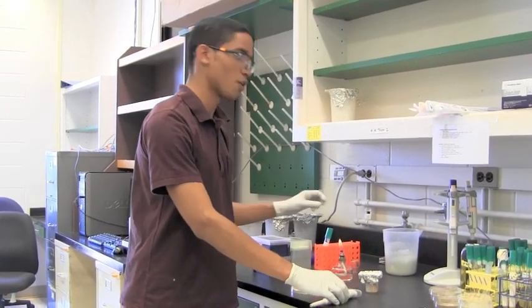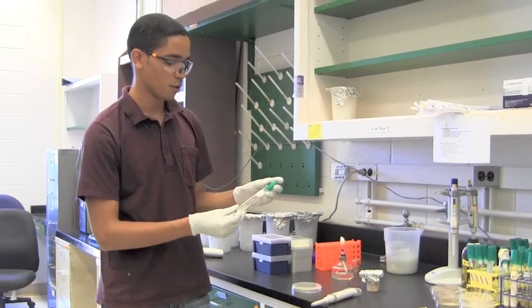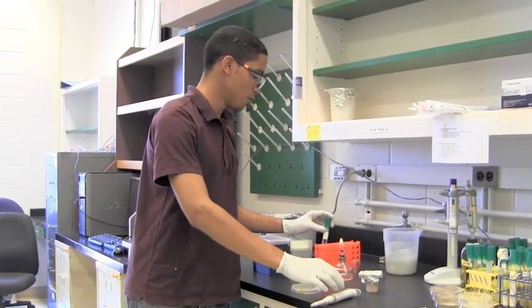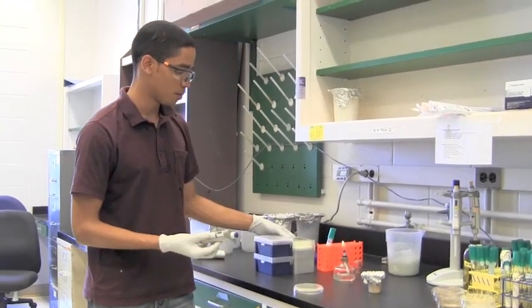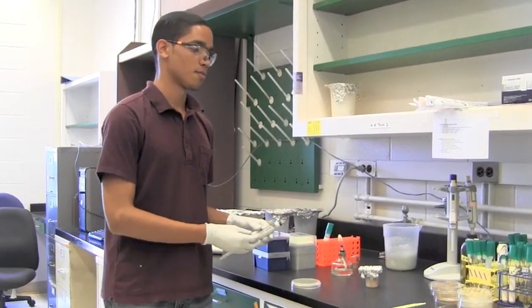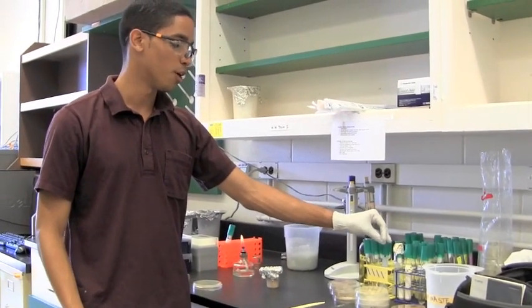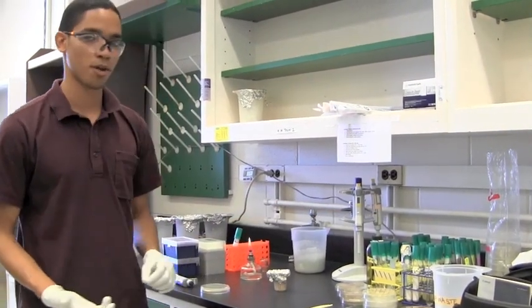So the things that you're going to use are an overnight culture of your bacteria of interest, a micropipetter and micropipet tips, and you also need glass beads to spread your inoculum onto the plate, hence the name spread plate.